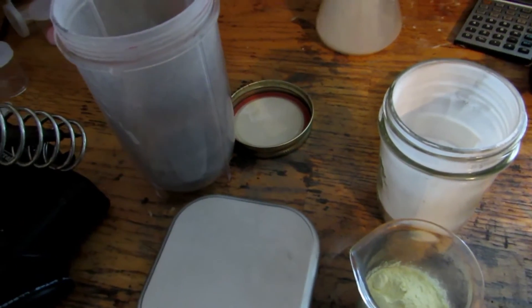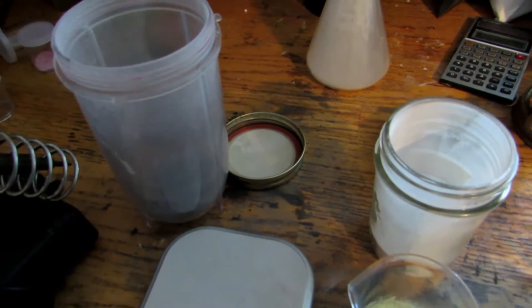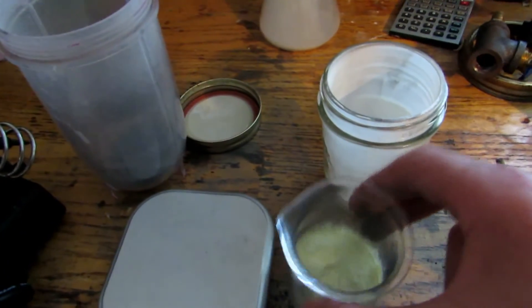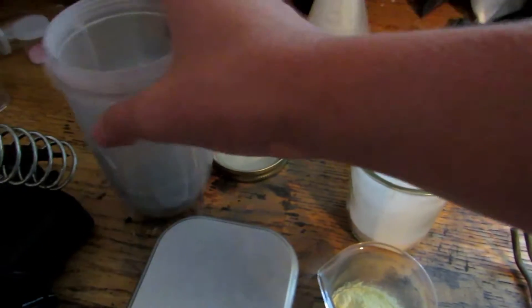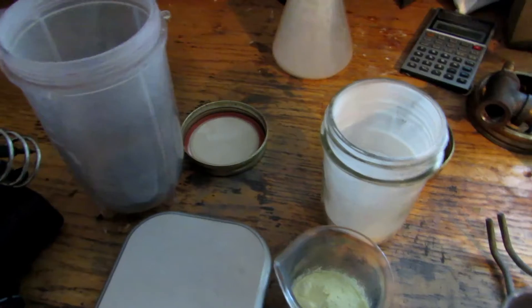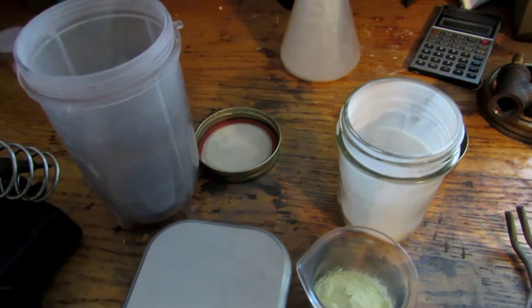That actually didn't work so well — I realized I made a mistake. Instead of every one gram of silicon dioxide you add 1.6 grams of aluminum powder, it's actually the other way around. So I messed up on the ratios. But as you saw, we clearly did make silicon metal. I'm going to try this again but this time we're going to add sulfur. The sulfur ratio is 9 parts silicon dioxide, 10 parts aluminum powder, and 12 parts sulfur. This will hopefully produce some reasonable chunks of silicon metal. This reaction will produce silicon metal and aluminum oxide, but also aluminum sulfide — a very hot reaction that will drive everything else forward.